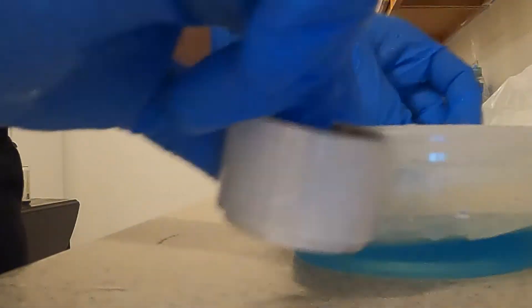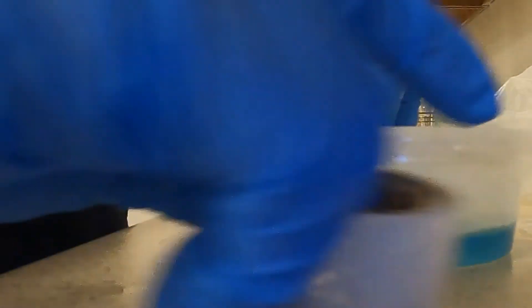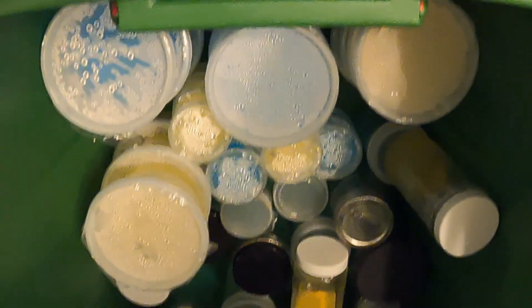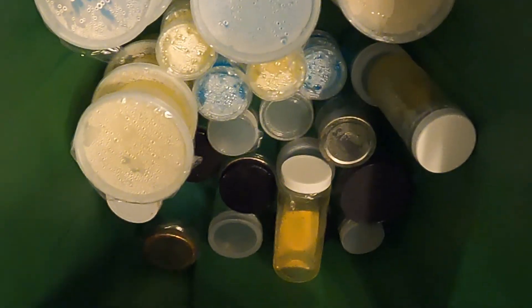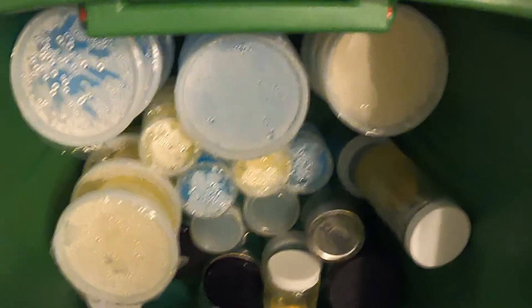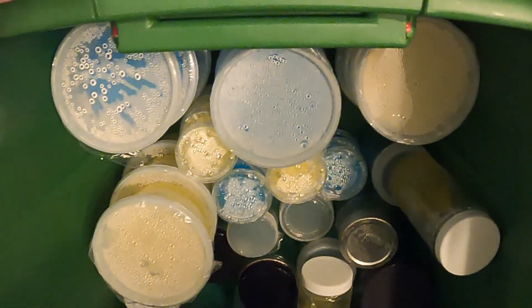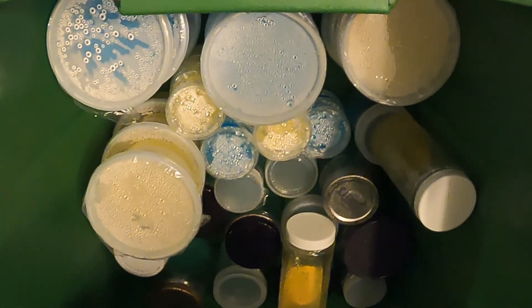I then take my little roll of saran wrap and go around at least twice. Now that my media is made and sterilized I store it in a cool dark place in a bin that I've sprayed with bleach. I let it cure for at least two days usually about a week and it's good for about one month.